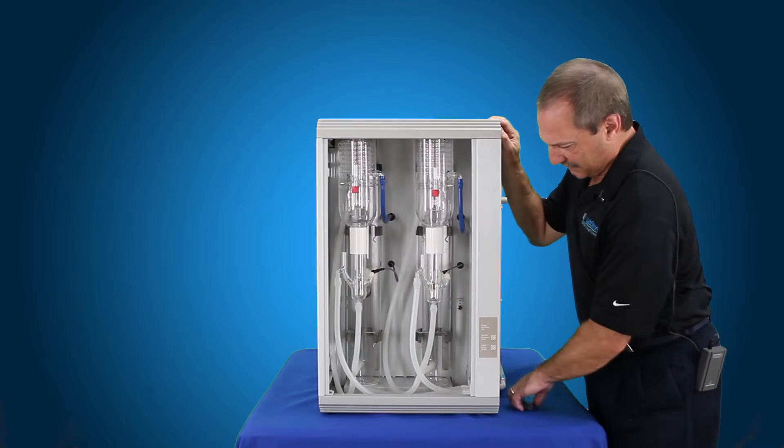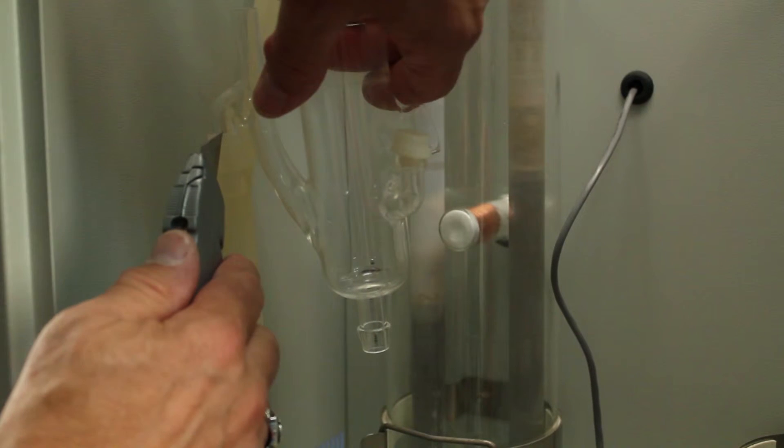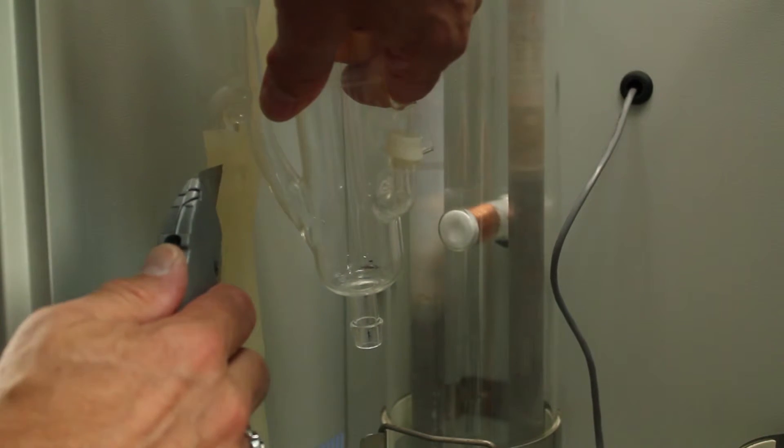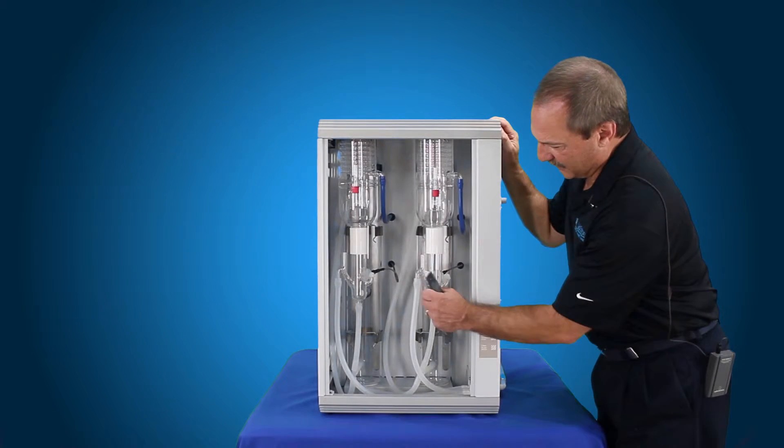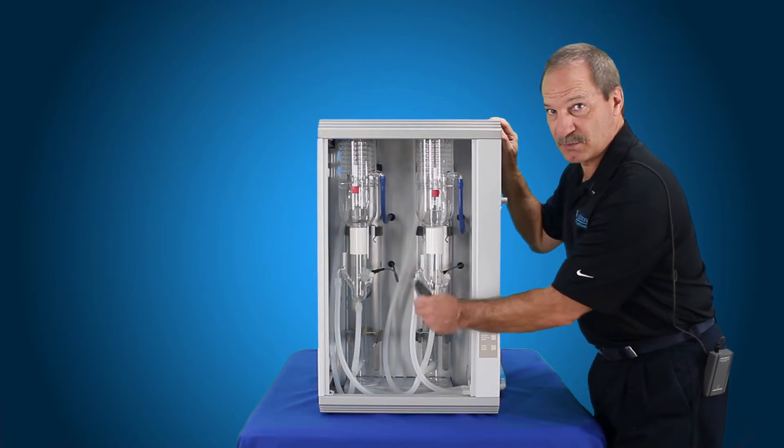What we're going to do is you're going to take a knife and you're going to slice the tube straight down lengthways, and then you'll peel that around the glass to remove it.